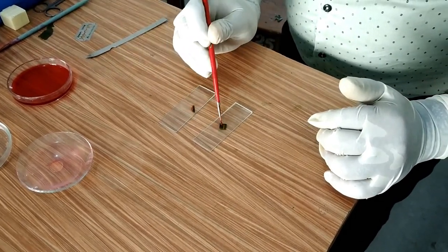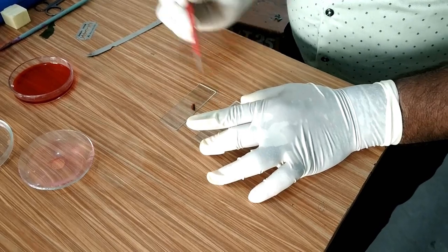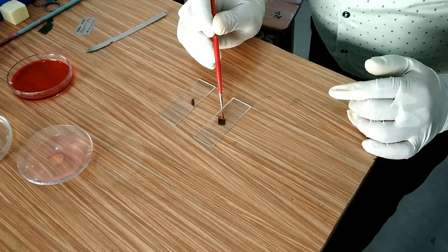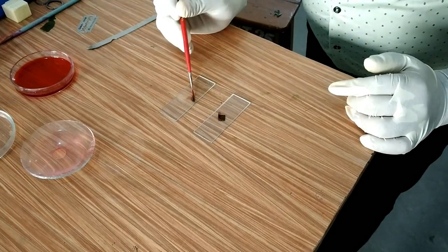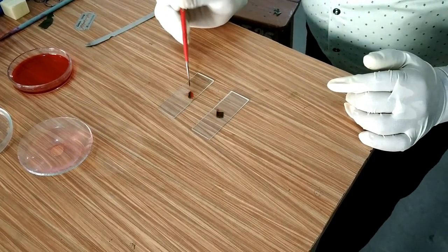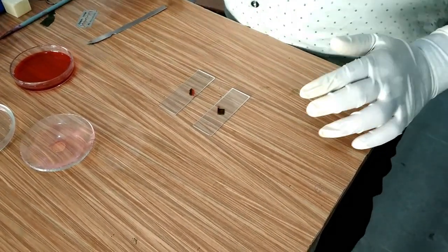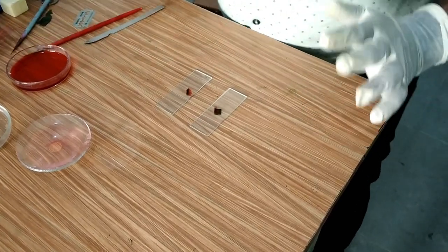I will give a very little drop of safranin stain on both of the slides, and then I will wait for 30 to 40 seconds.